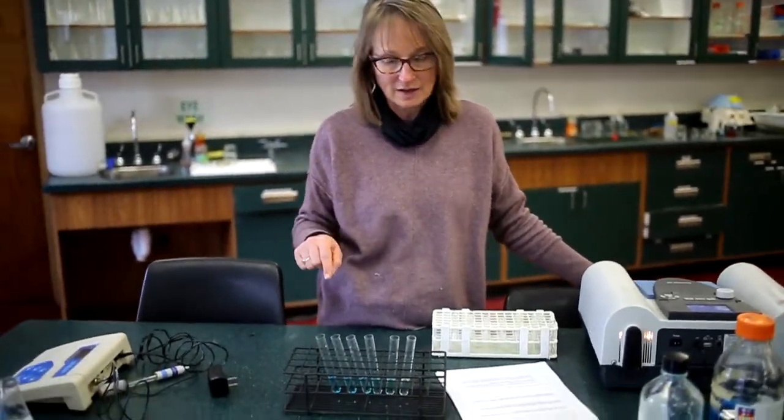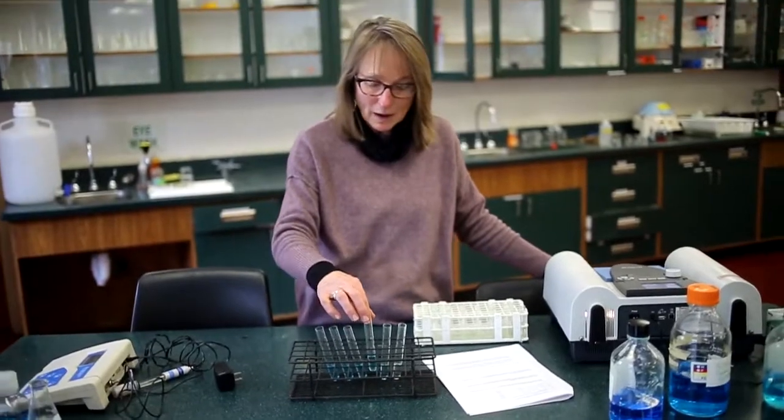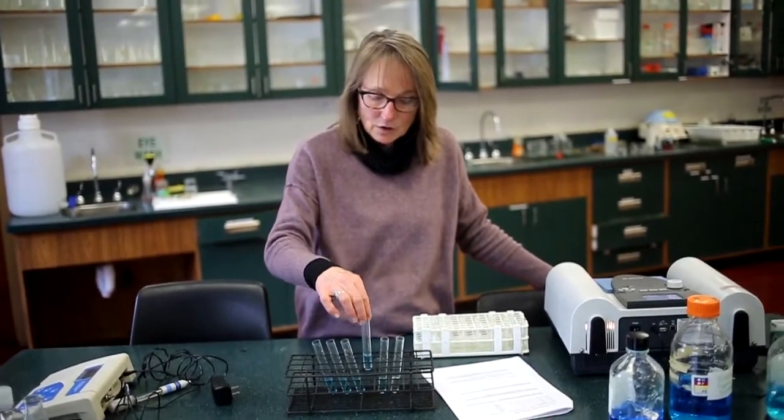So the next thing that we're going to do is use the instrument to distinguish among various concentrations of this blue color. You might want to do that. You can use very low concentrations of copper sulfate to kill algae in ponds or swimming pools, but you wouldn't want to use too much. So it might be important to test the concentration or know it pretty precisely.